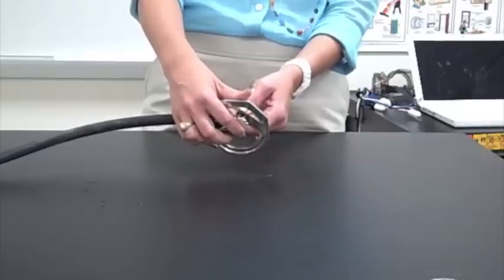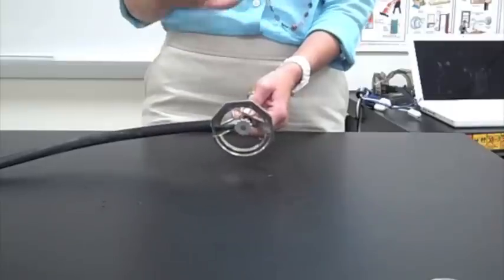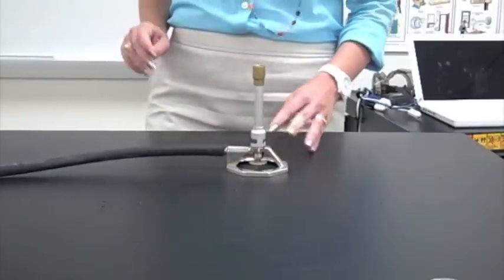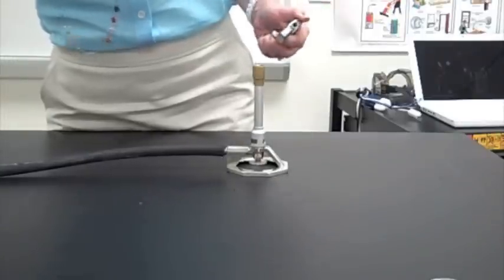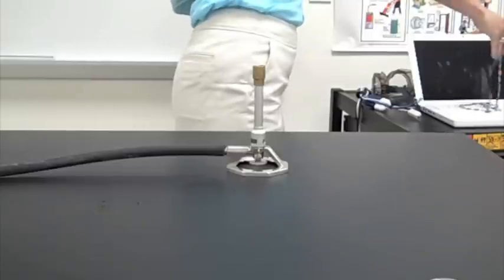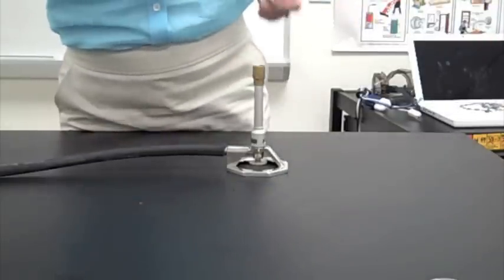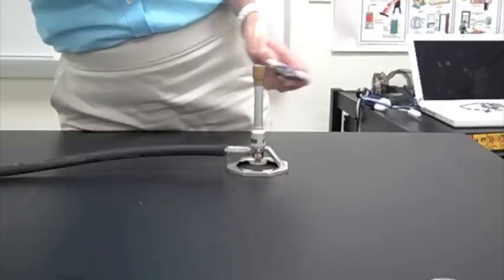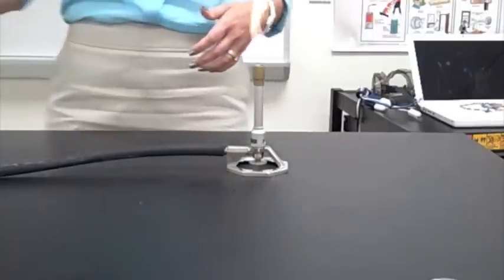If you light your Bunsen burner and you have a flame that is a measly little like two inches tall and you get a two-foot flame, then I'll come by and help you fix it. But for right now, we don't need to deal with this one. We've got that guy set up. To light your Bunsen burner, you'll call me over. I'll tell you to turn on the gas. I'm going to take my necklace off before I do this. Make sure my hair is all the way back and my goggles are on. Turn the gas on, light it, and up it goes. And you'll see we have this yellow flame, which is the kind of flame you want for the first part of this experiment.